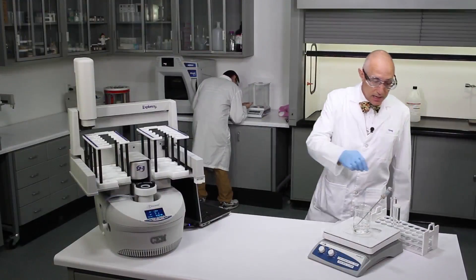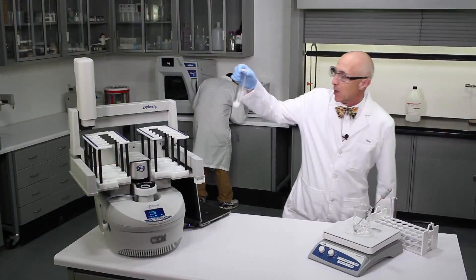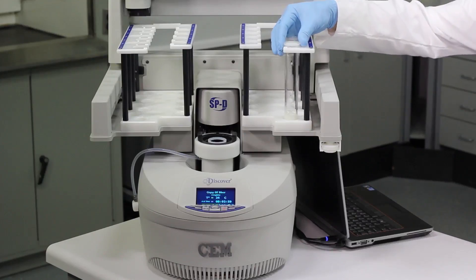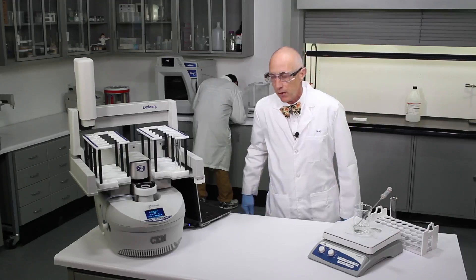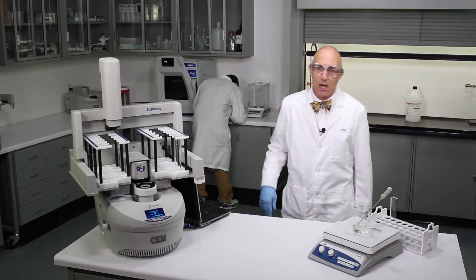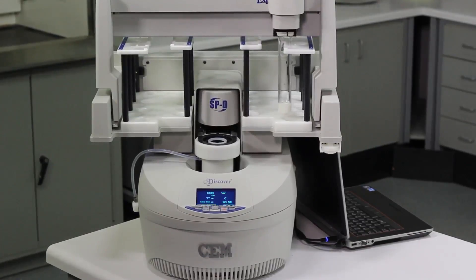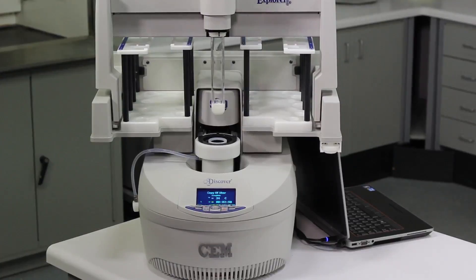What I'm going to do is take my reconstituted cheese powder sample and 5 mL of nitric acid and put it in the rack up over here. We're going to start the system — it's going to pick it up and put it in the microwave cavity. While it's doing that, let's go through how you prepare the sample.